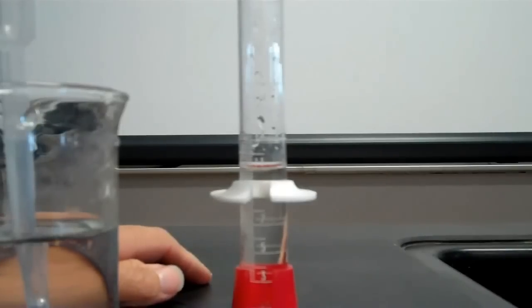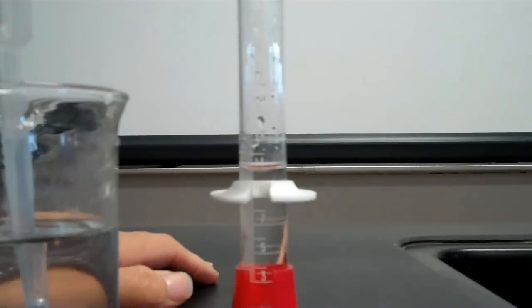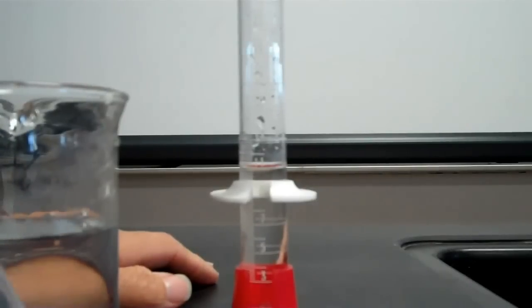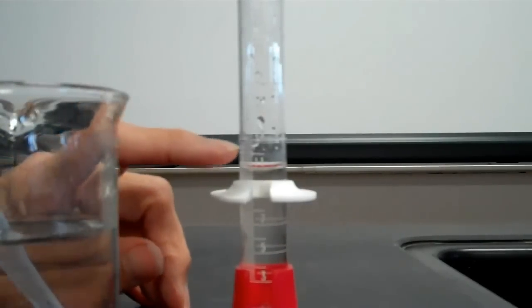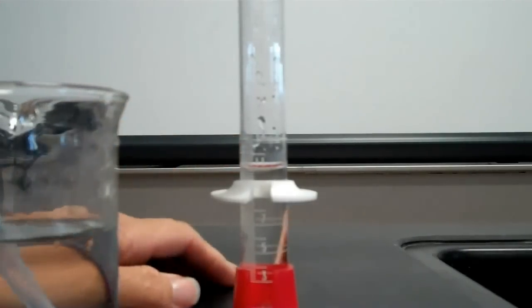And I'm going to stop there. And then I'm going to write that down on my data table. And then I'm going to go from 11 to 12 and count again. Now remember that 12 is right here. It's not all the way up here. That's 13.